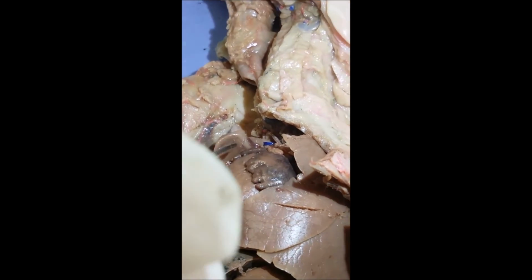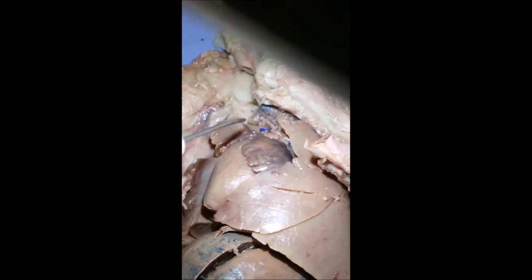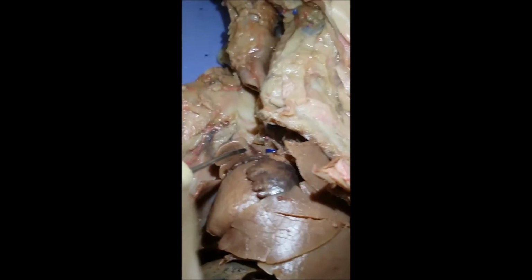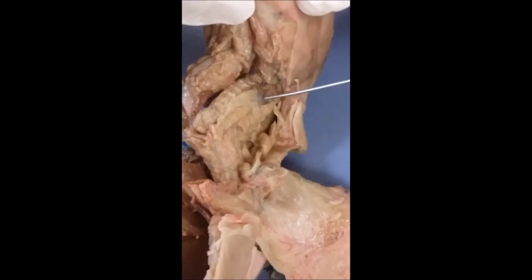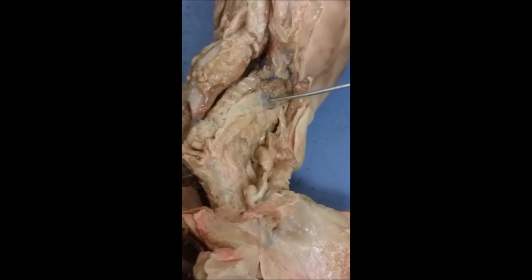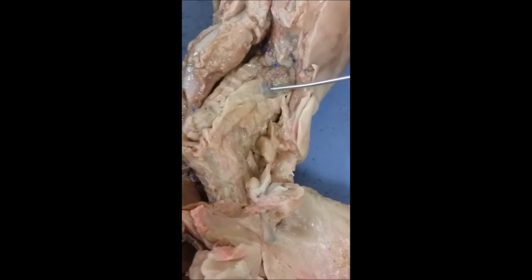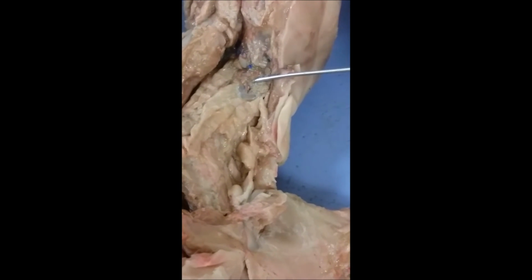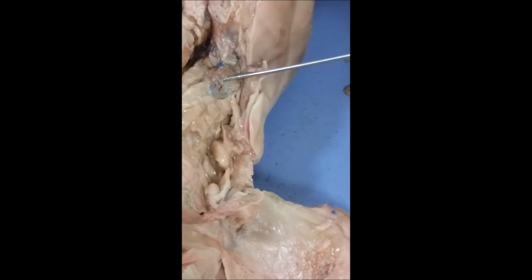Okay, up here is the anterior vena cava, and it goes into the heart, and the posterior that we showed earlier goes from the heart in the bottom. So right here, the external jugular vein, which drains the head and neck, and into the internal jugular vein, which drains the brain.